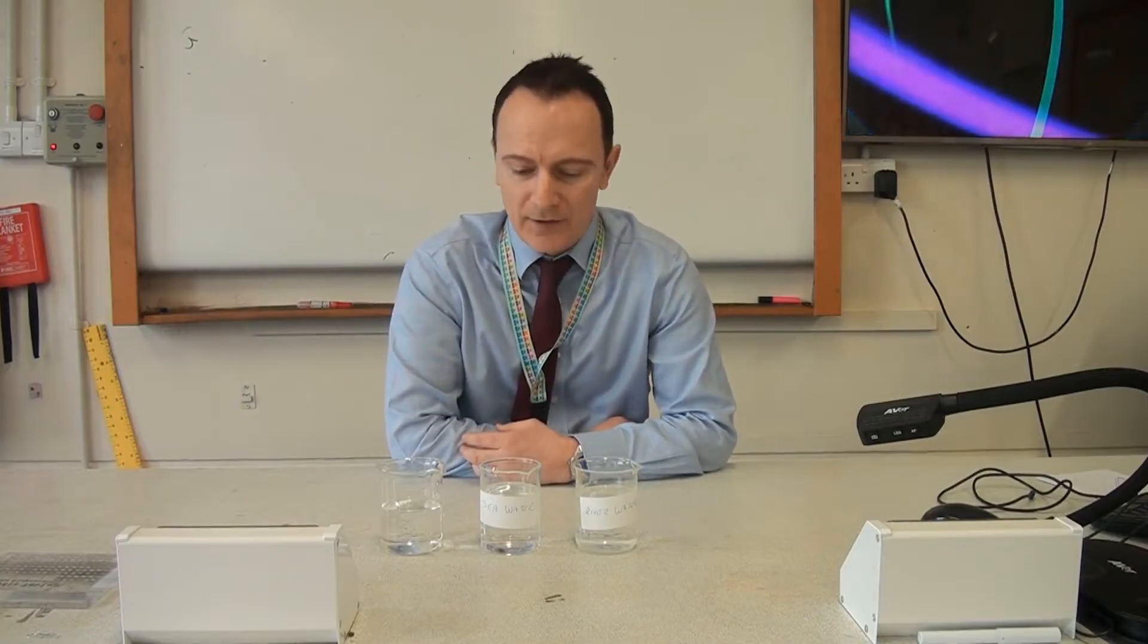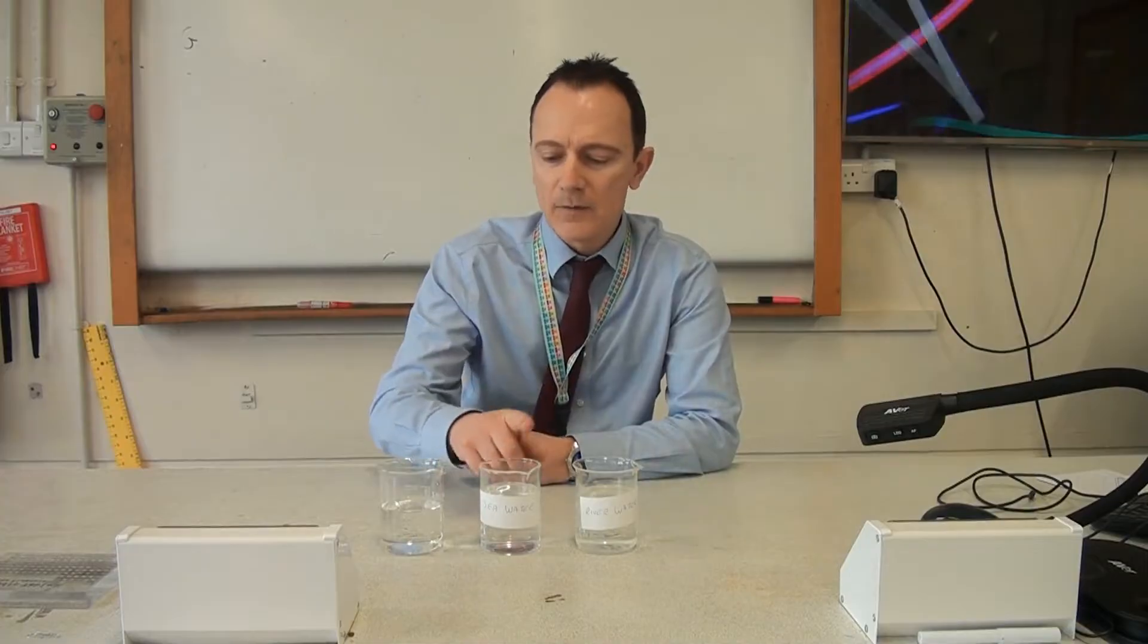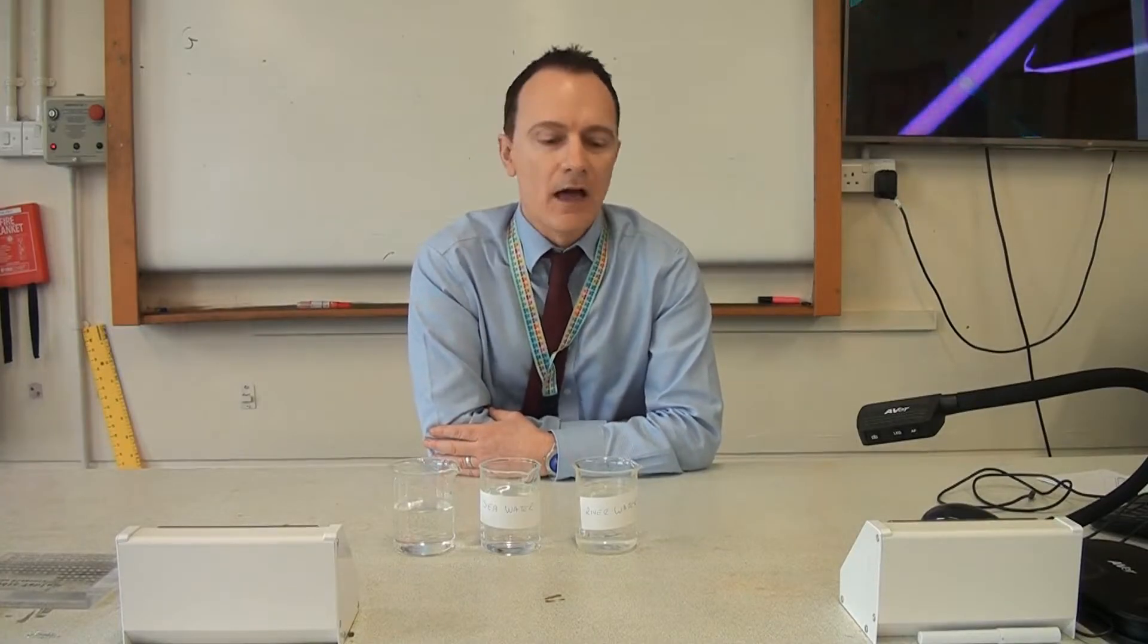So it's really in two stages. I've got here three samples of water: river water, seawater, and some good old tap water. What we're going to do first of all is have a look at the amount of dissolved salts in those samples of water, and we're going to do that by evaporating the water to see what salt is left behind. The second part of the practical is looking at how we can purify that water by using simple distillation.